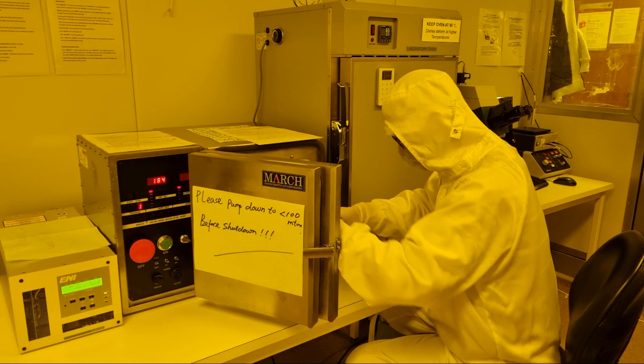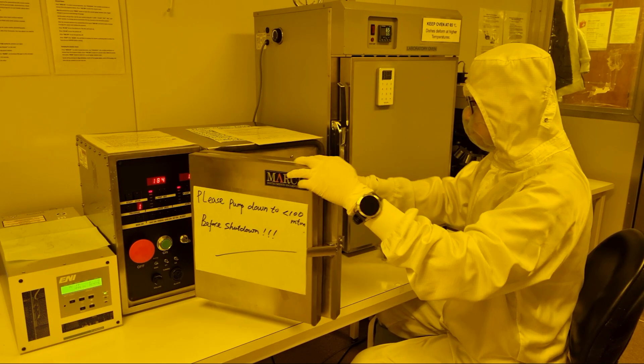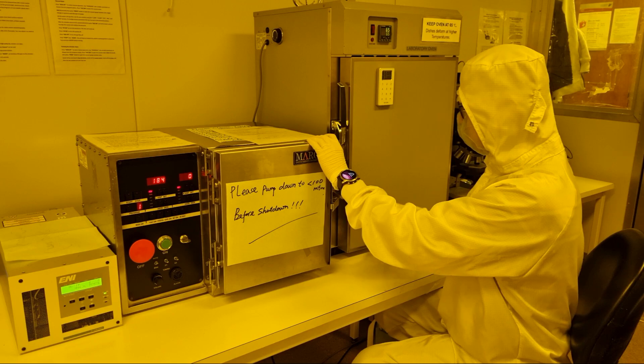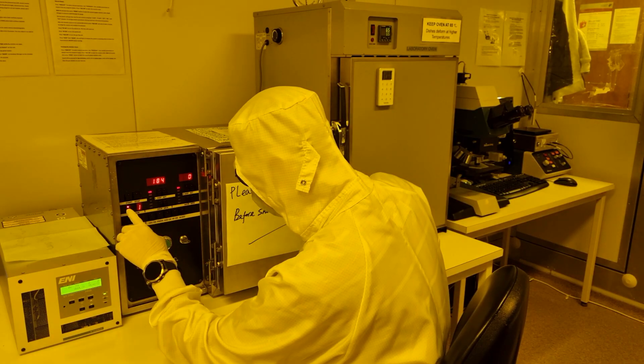Make sure the wafer is centered and on the correct platform. Here we will use a five-minute oxygen plasma at 300 watts in our March PX250. There is a YouTube video about this instrument in the playlist.